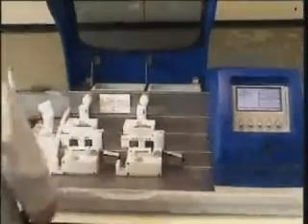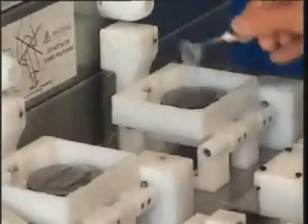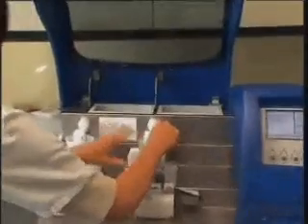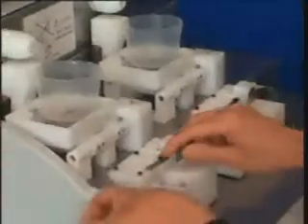Performing the tests on CellSlide is quite simple. First, a membrane filter is placed on each tower, followed by putting a disposable funnel on these towers. Two clean microscope slides are placed on the system. The CellSlide computer controls the presence of the funnels and the slides in the correct position.